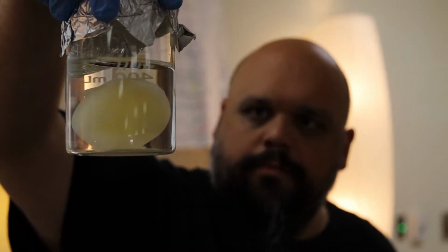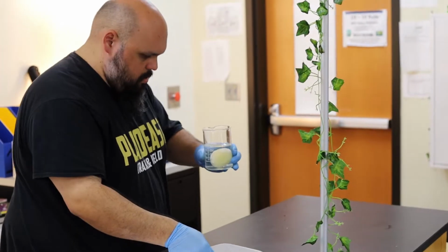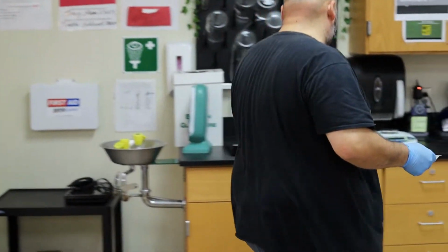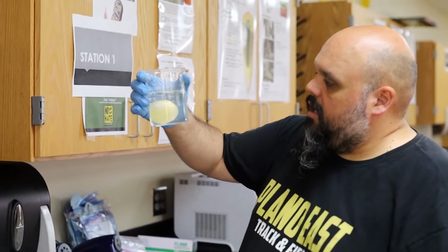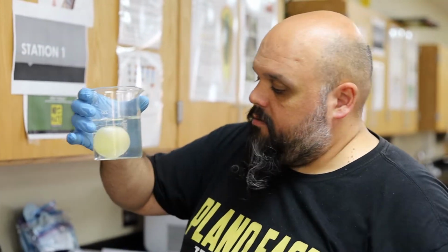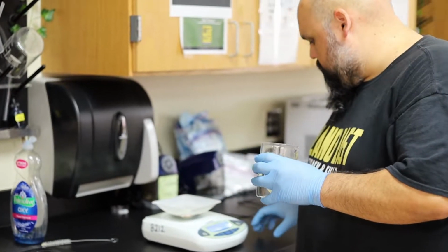Oh yeah, looks a lot different than yesterday. Come with me to the balance corner. All right, remember when I said yesterday, last time, that taking the egg out of the syrup was very dangerous? Well, that was a lie, because it wasn't. This is dangerous. All right, if I mess up here, it'll pop like a balloon. Okay, I'm going to be very gentle.